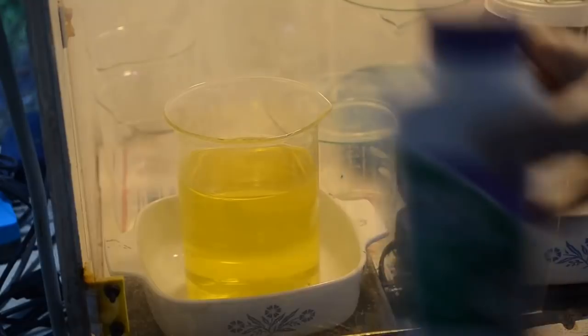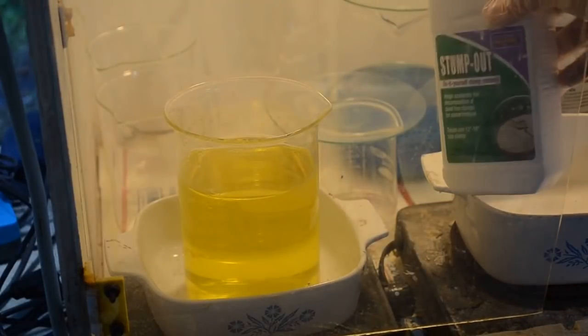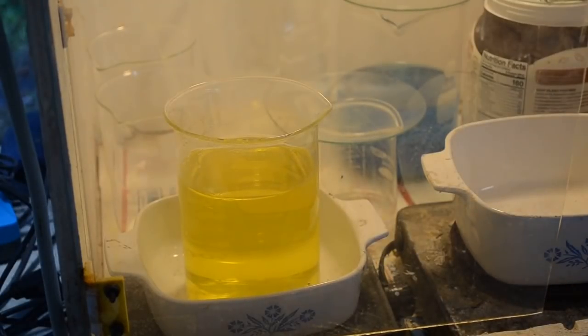I got my jar out here, my bottle with the sodium metabisulfite in it, SMB. And I don't know if there's enough left in here. I do have another one. We'll see if this will do the job.